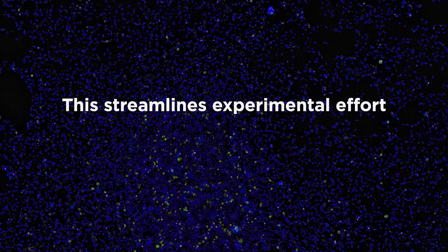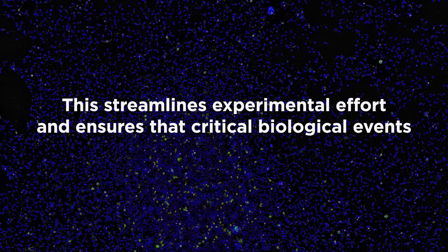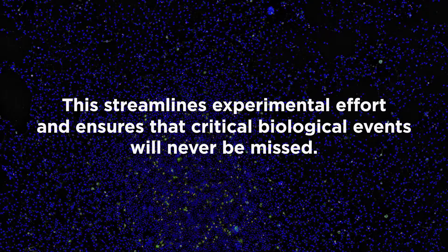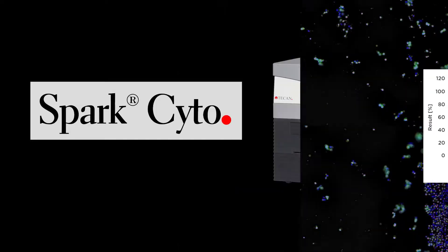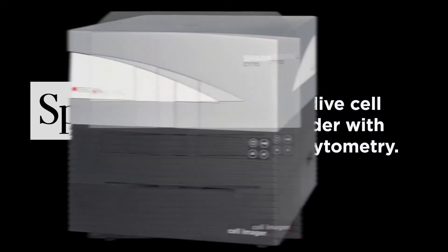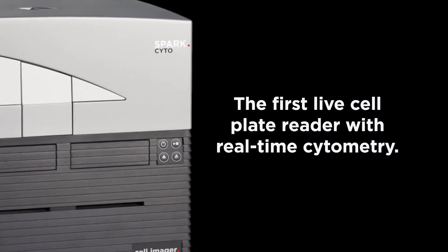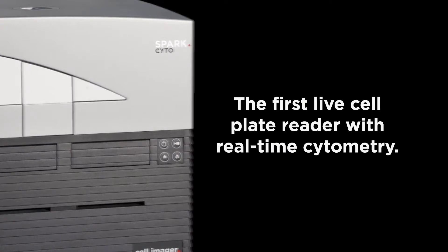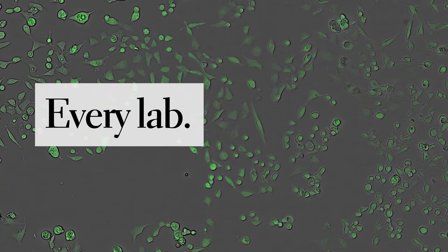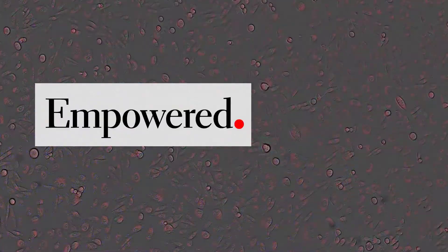This streamlines experimental effort and ensures that critical biological events will never be missed. SparkCyto — the first live cell plate reader with real-time cytometry. Every lab, every day, empowered.